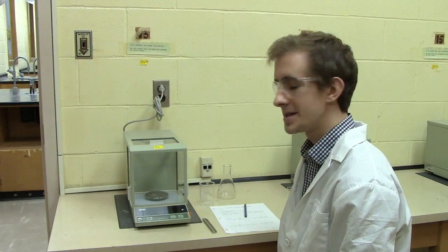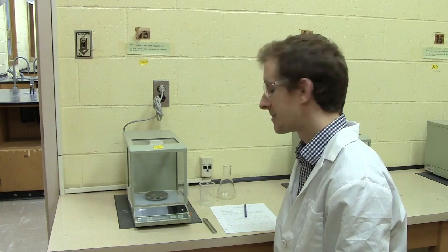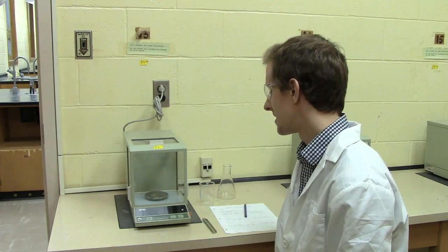This is the analytical balance. The analytical balance is used for measuring precise measurements up to four decimal places. Its maximum load is 120 grams.